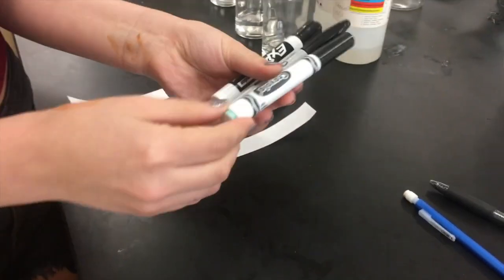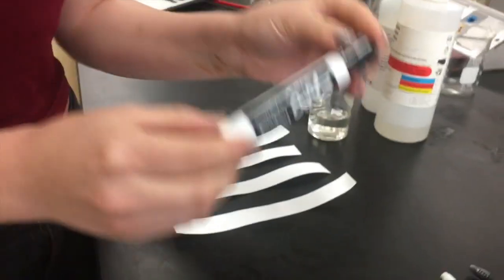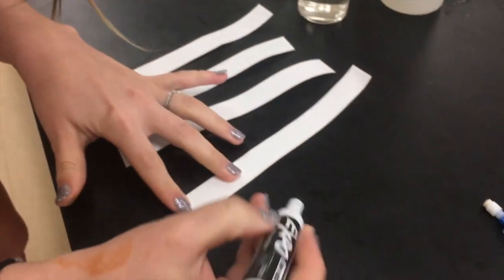Then you get three different markers. One, we have a Crayola marker. Two, a Sharpie. Three, an Expo dry erase marker. And there you go.